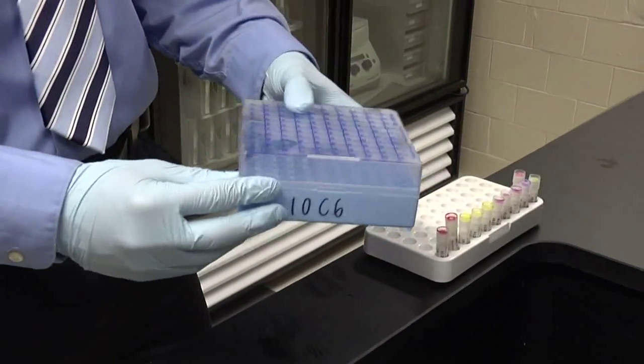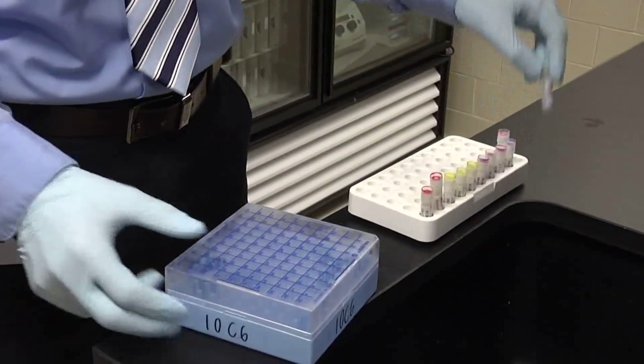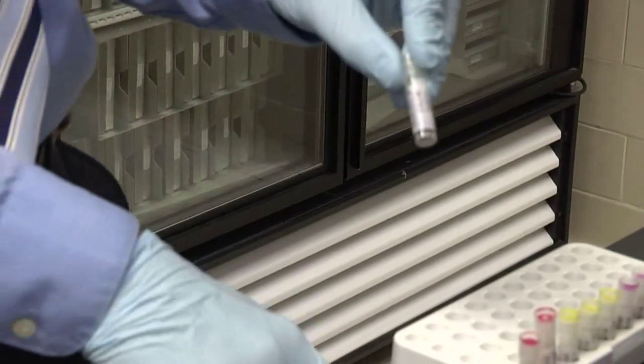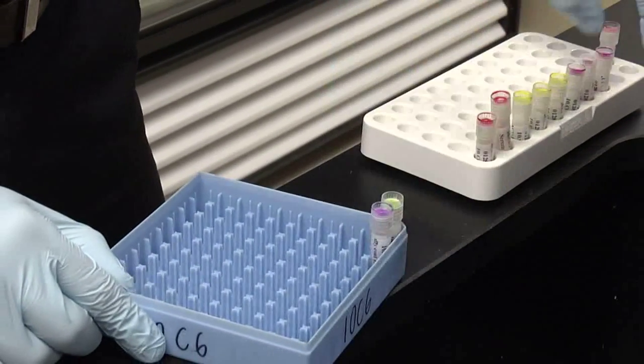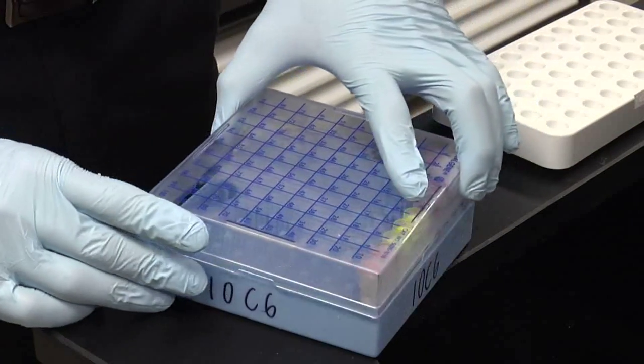After taking out the correct box, ensure that it's the correct position for each sample by looking at the label and matching it up with the box. This will be in position one inside the box, followed by position two and so forth. Now these samples are ready for storage.